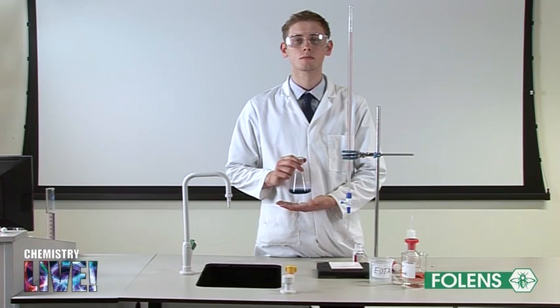We carry out one rough and two accurate titrations which should agree to within 0.1 cm³.